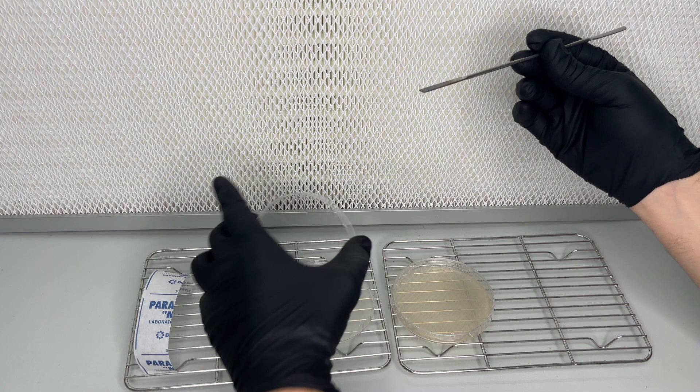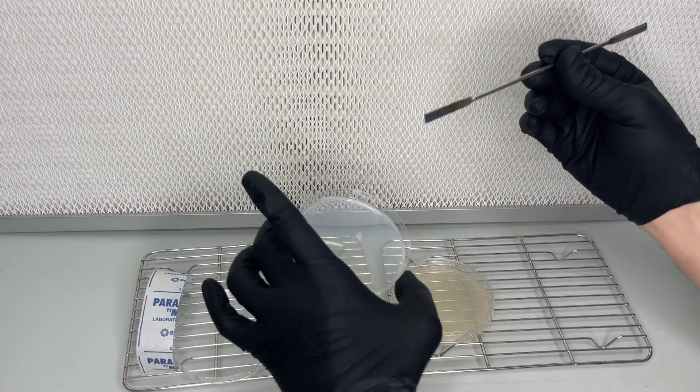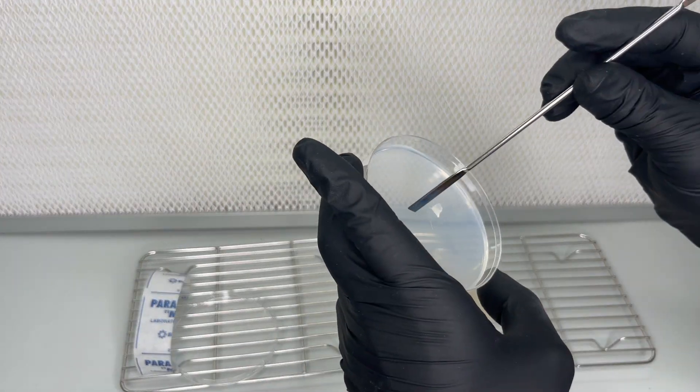Here I used a flame sterilized scalpel to transfer some of the thin mycelium over to the nutrient agar plate.